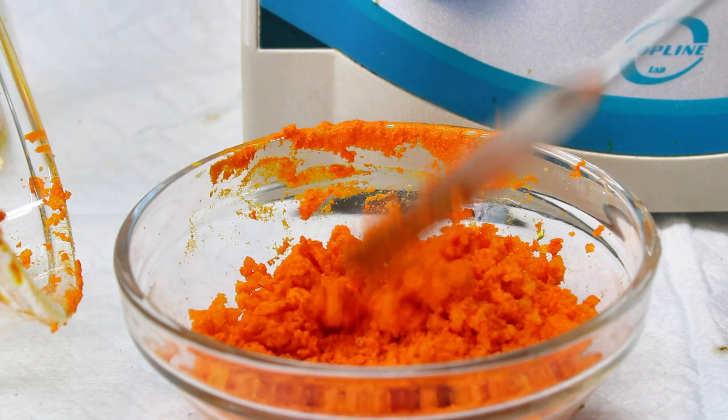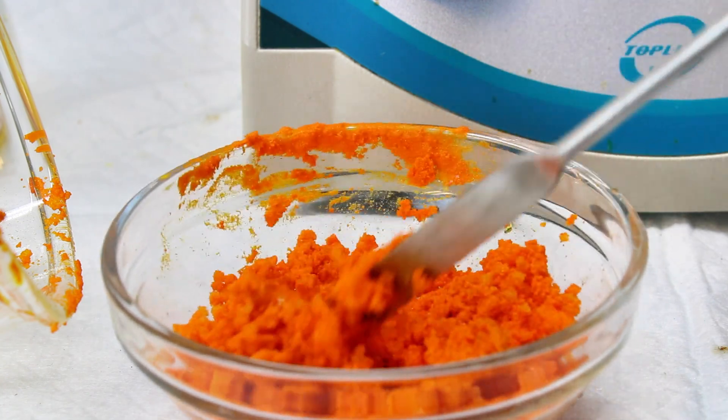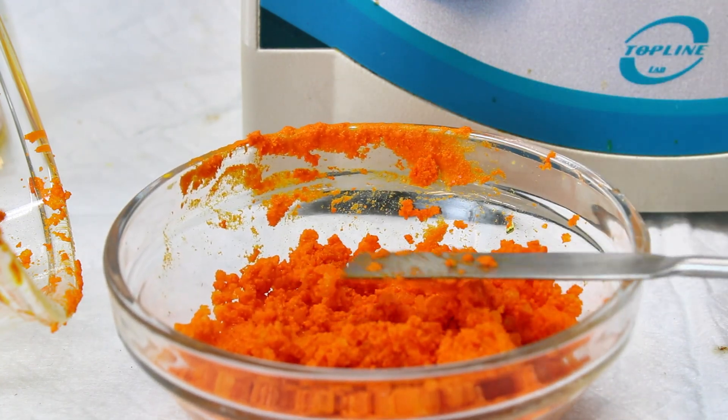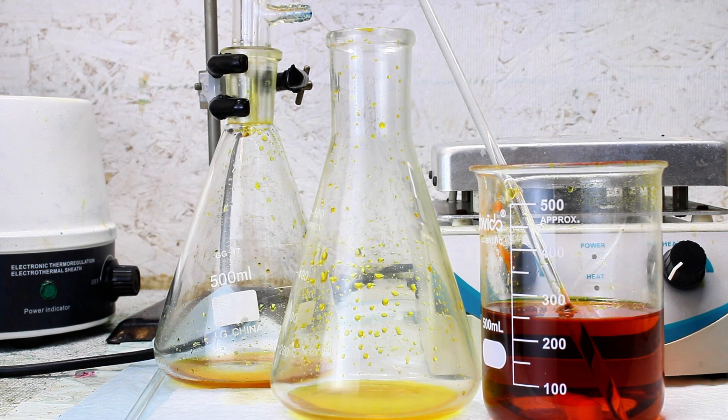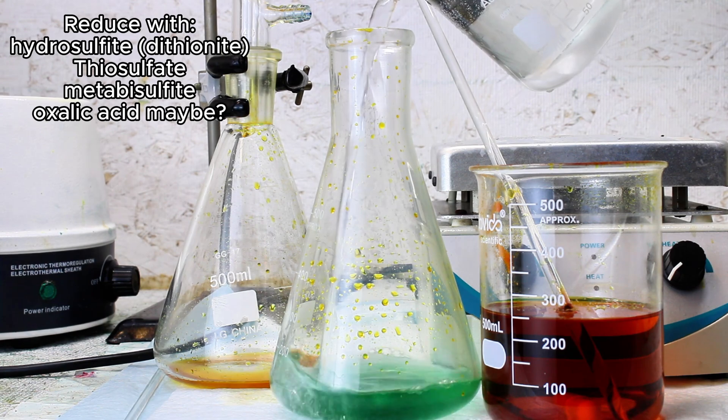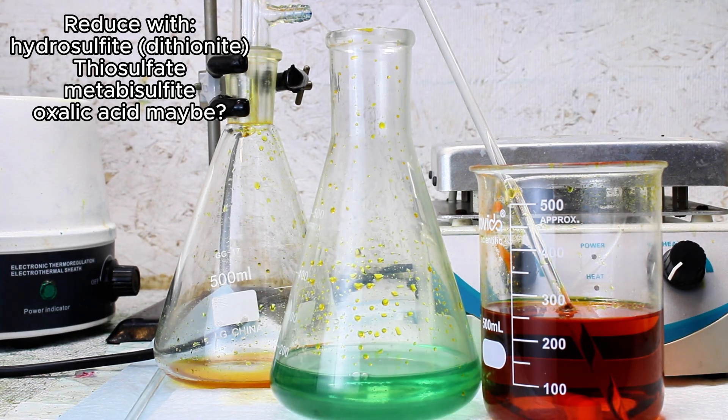However, I don't really need any more dichromate. I've got about five pounds of it, and since this stuff scares me more than the vast majority of chemicals, I decided to neutralize the filtrate as well as anything that touched the stuff with a whole lot of sodium hydrosulfite.